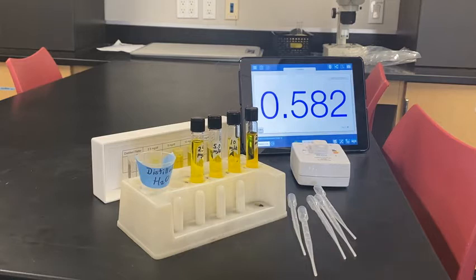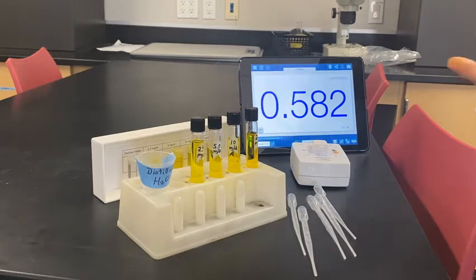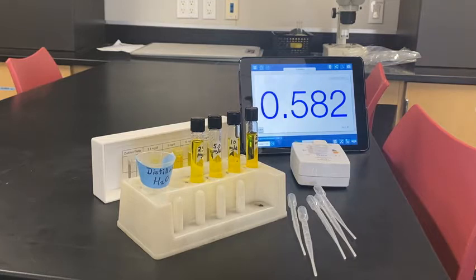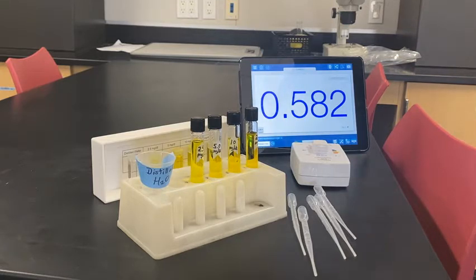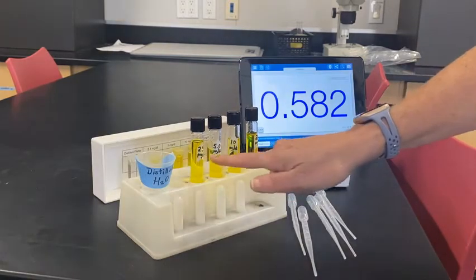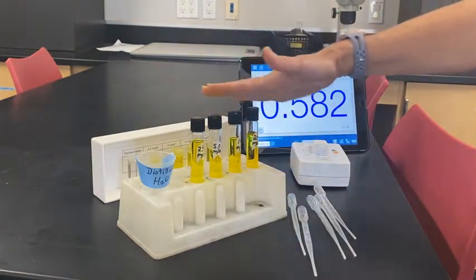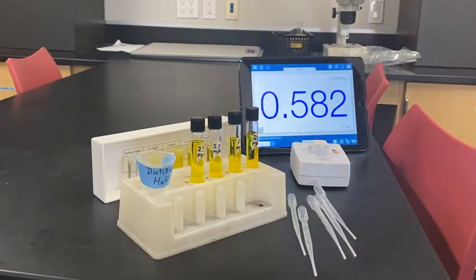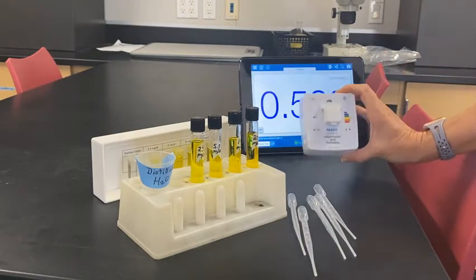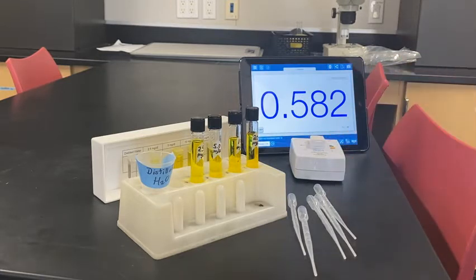For today's lab, you are going to set a standard curve to determine your patient's total serum bilirubin. To do that, you have to have some known quantities of bilirubin in the serum, and you're going to use this device called a colorimeter to actually make your standard curve.